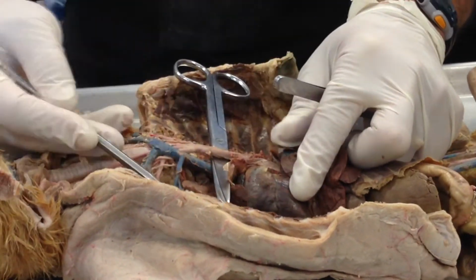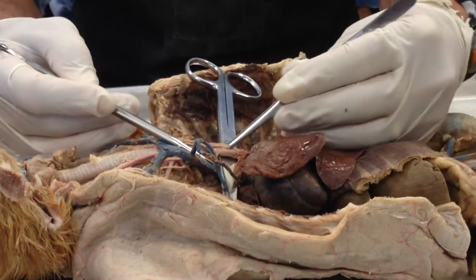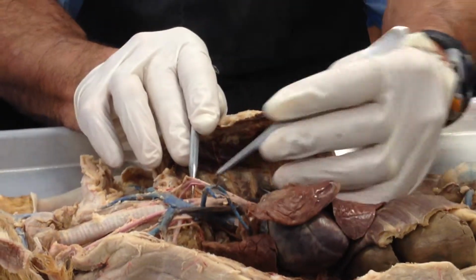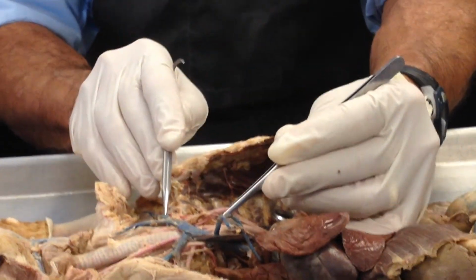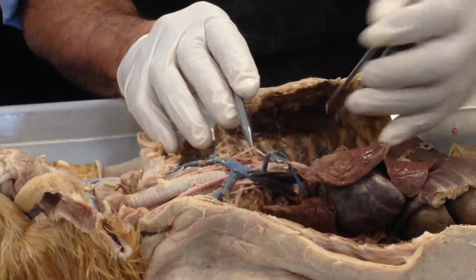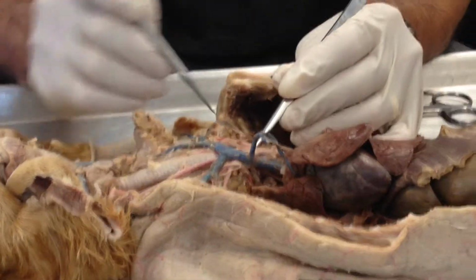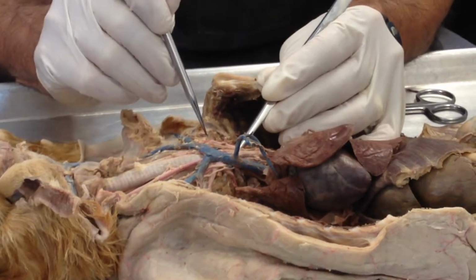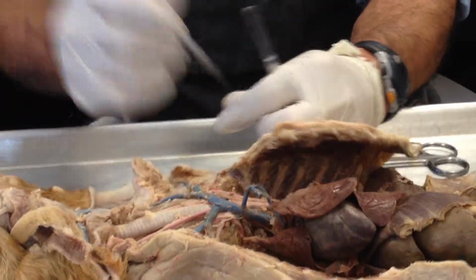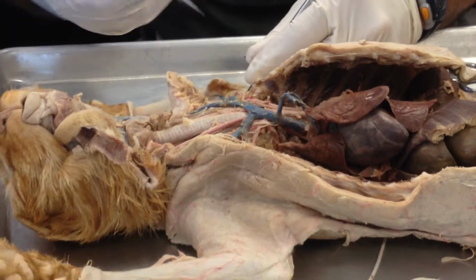Then, folks, this left artery, the second big one, is this long left subclavian artery running all the way there. There we can see more branches of the vagus nerve running down. So that left subclavian artery loops around the first rib and follows the same pathway as the vein next to it.